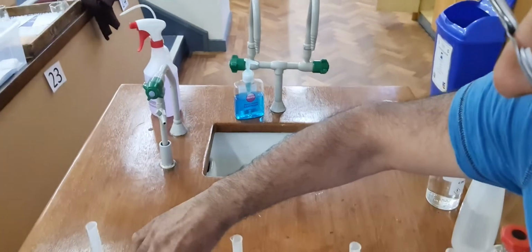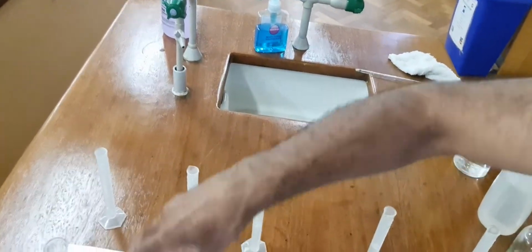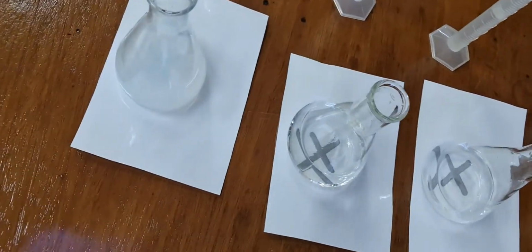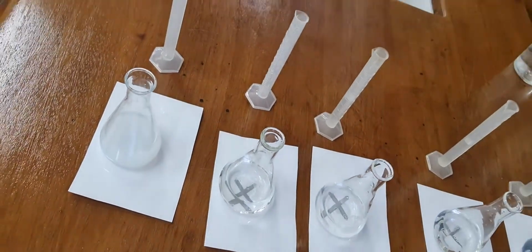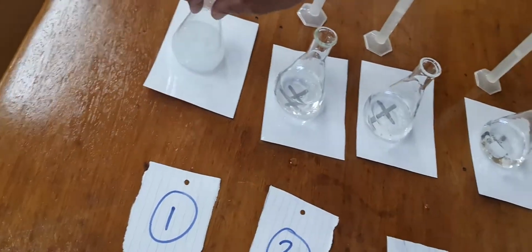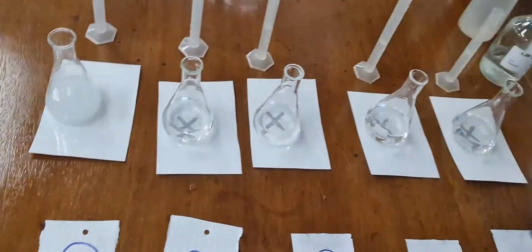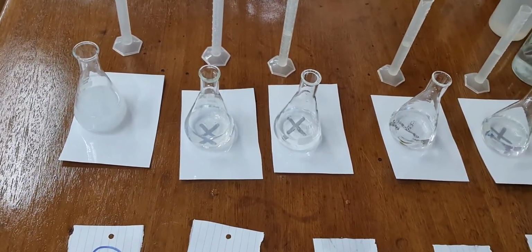Right, that's 30 seconds. I want you to see that one going. Right, so that is like 50 seconds.